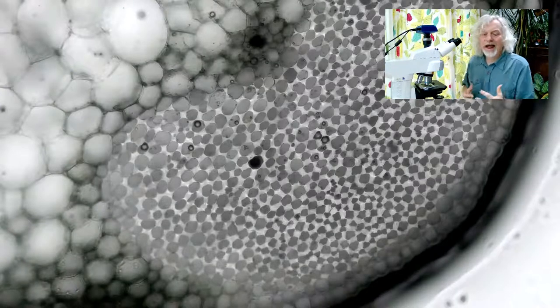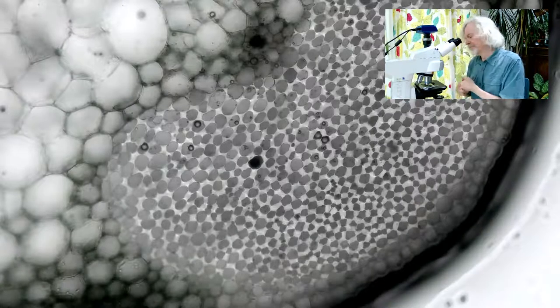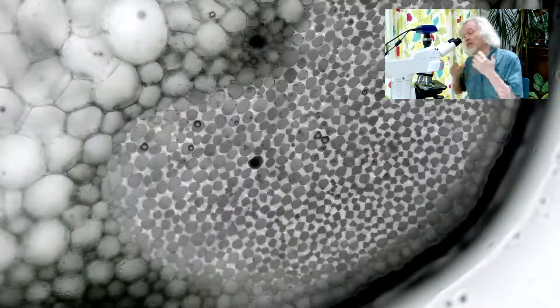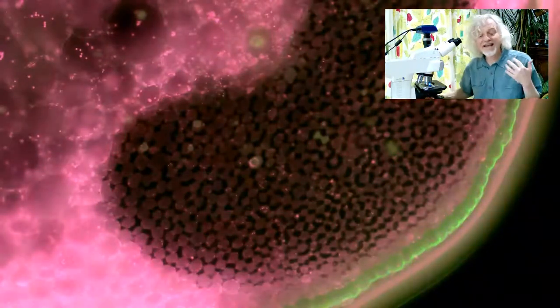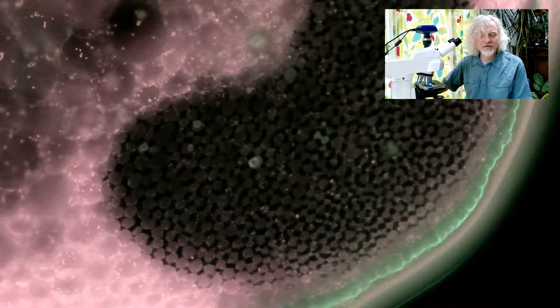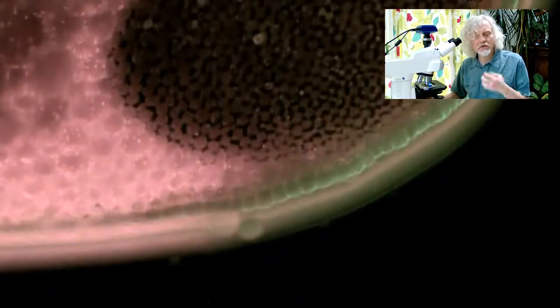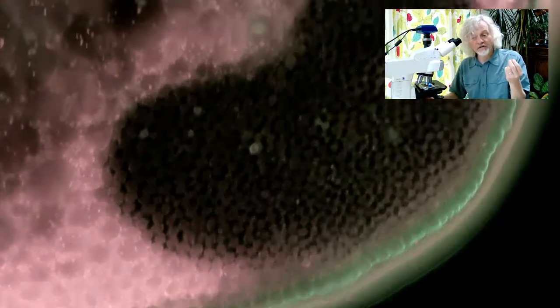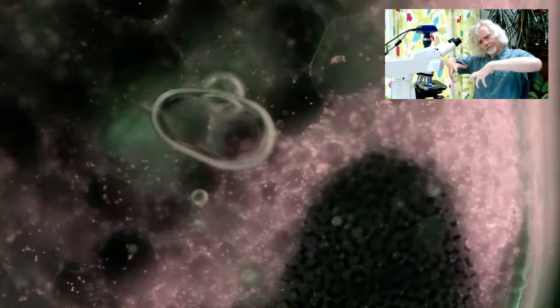Now, all of this is quite cool. But actually, it's slightly tricky to identify some of this stuff without staining it. And normally, you would use toluidine blue, but I'm just going to use ultraviolet light. And I'm going to shine ultraviolet light on it, which has the effect of making different parts of the cell glow. And this is rather cool. I love doing this. So what I'm shining now, the specific wavelength I'm shining on it, makes the very outside edge of the epidermis, you can see there, glow slightly green. But importantly, if it's red, it's got chlorophyll in it, because this wavelength of ultraviolet light makes the chlorophyll glow red.